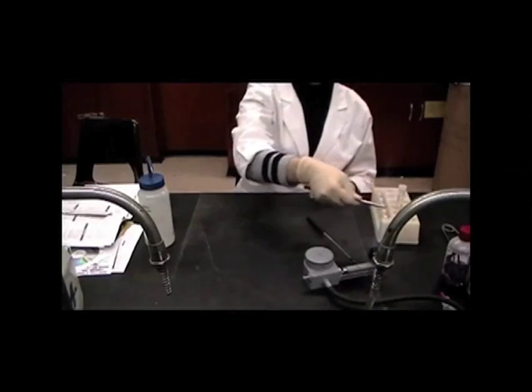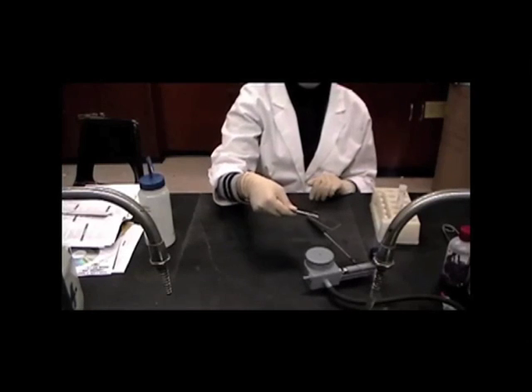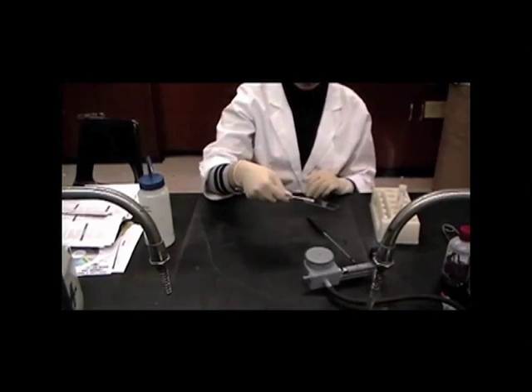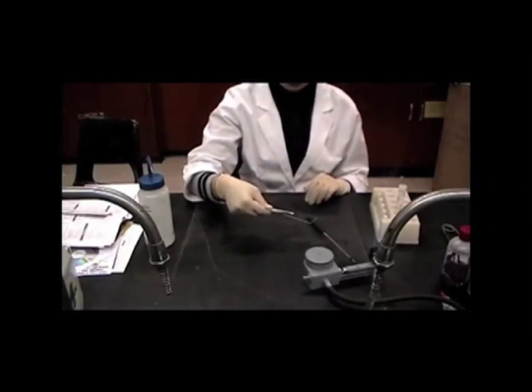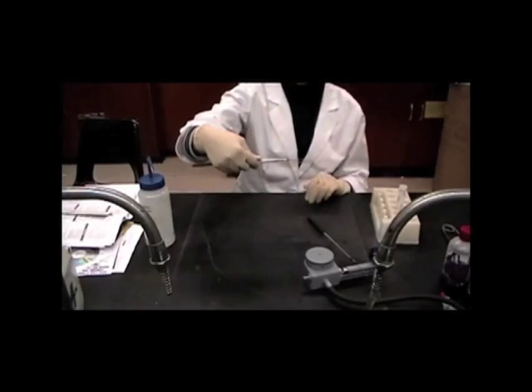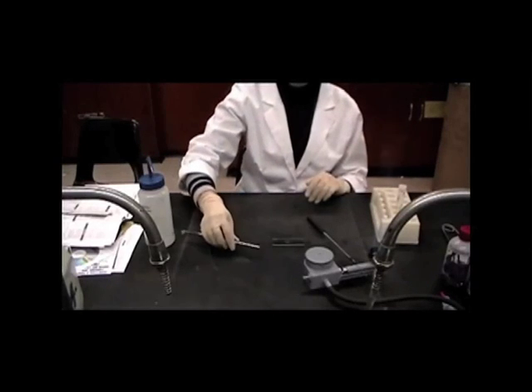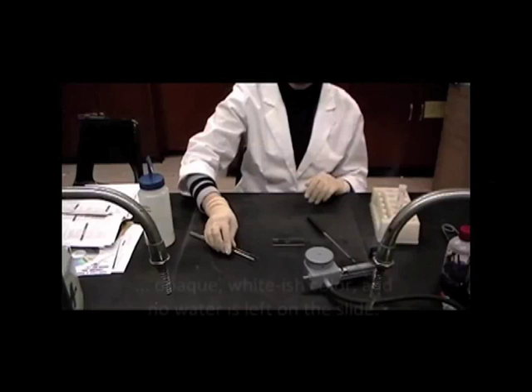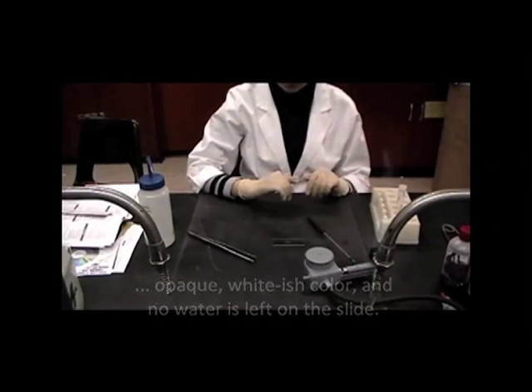Again, 2 or 3 times. Then you wait for the slide to cool. And at this time, the bacteria will be fixing onto the slide. Complete fixation is achieved when the bacteria is totally dried following passing of the slide through the flame. And the individual doing the work has to make sure that it's an opaque, whitish color and no water is left on the slide.